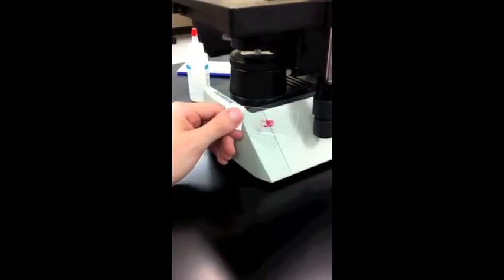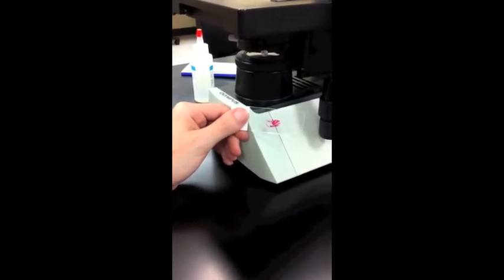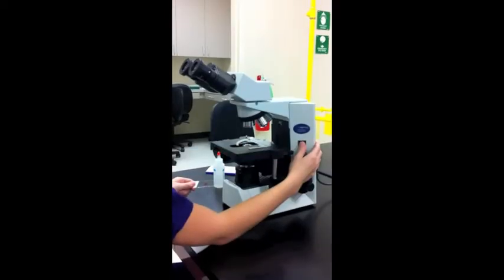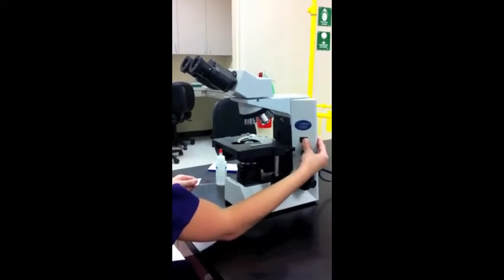The next step, number two, would be to make sure the slide specimen to be examined is free from dust. The next step, number three, would be to turn the microscope light on.